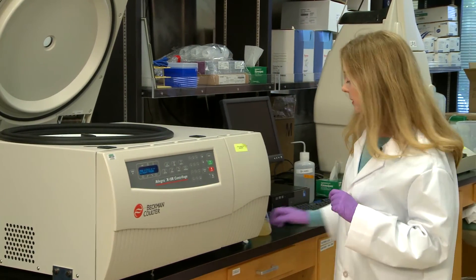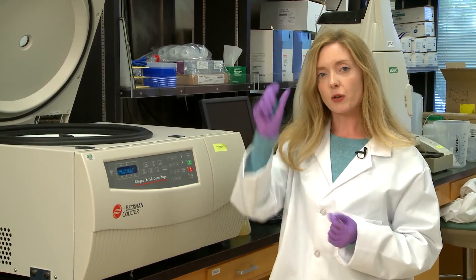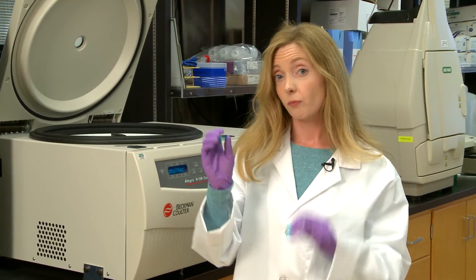Some other tips: use syringe filters. You can use a 0.2 or a 0.45 micron filter. And if that clogs up, you can always use a 0.8 micron filter — especially good if you have particulates in your sample.